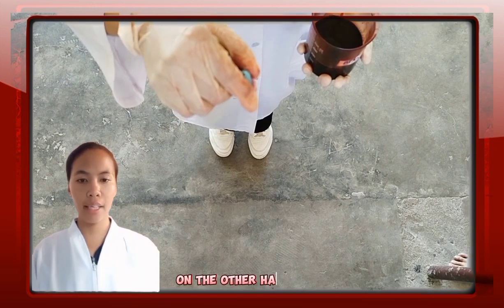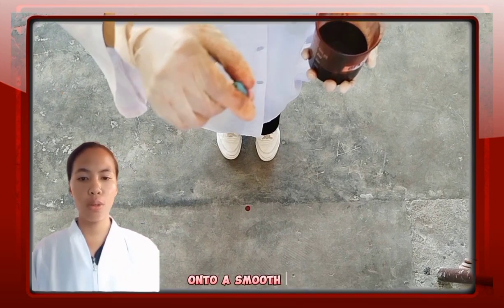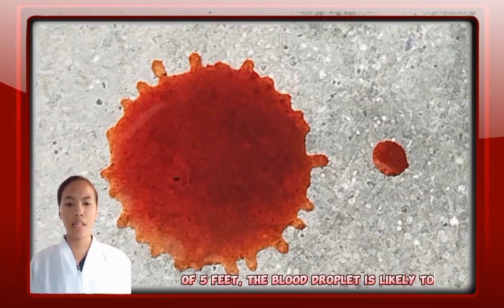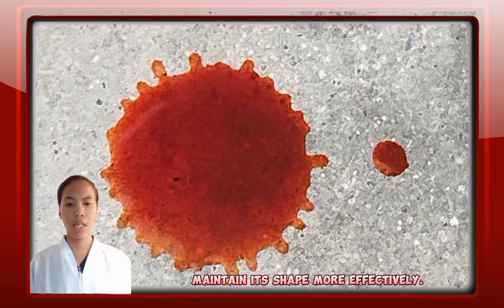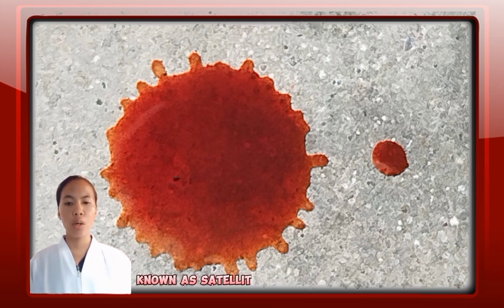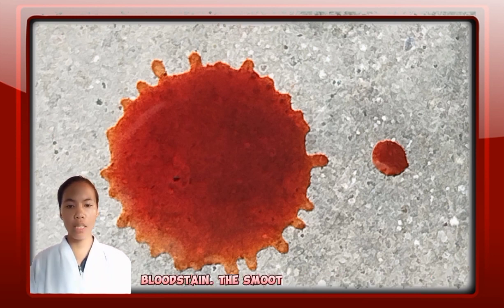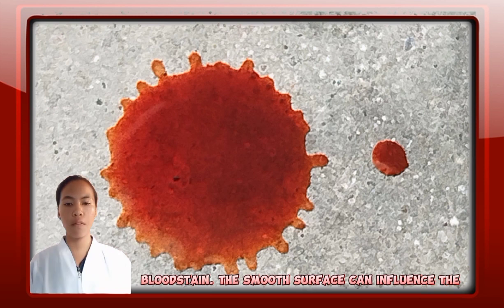On the other hand, when blood is dropped onto a smooth surface from a height of 5 feet, the blood droplet is likely to maintain its shape more effectively. Upon impact, smaller droplets of blood, known as satellite spatter, may be ejected from the main blood stain. The smooth surface can influence the saturation and absorption of the blood stain.